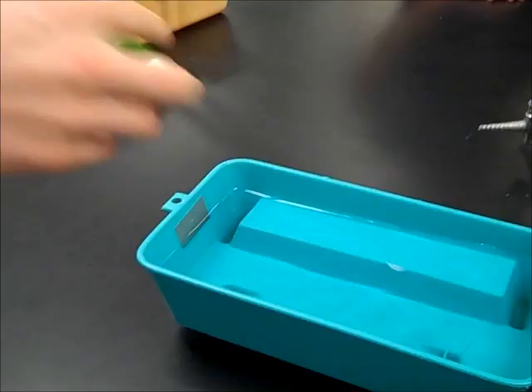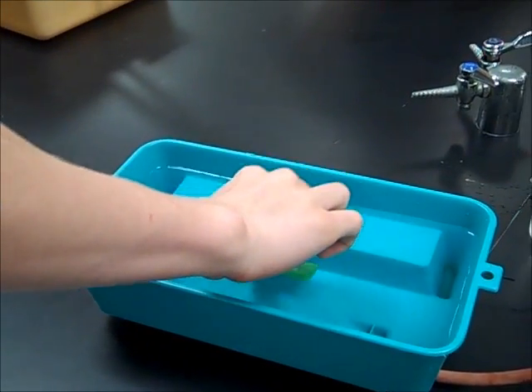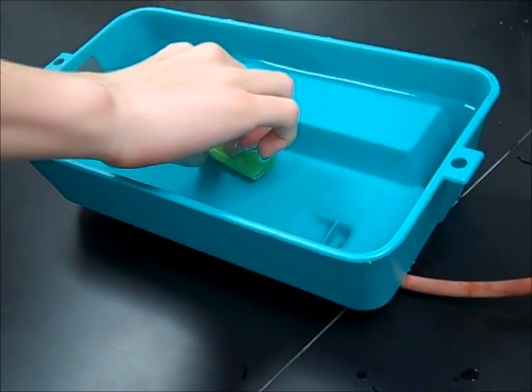Three-fourths full. Alright. You have to spray your water. Okay.